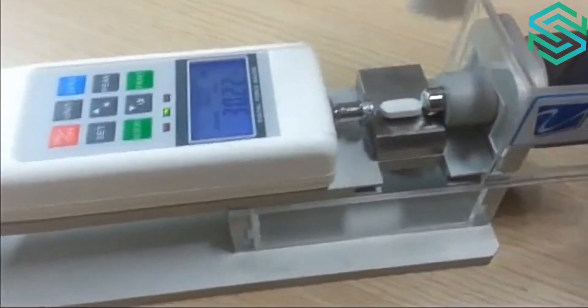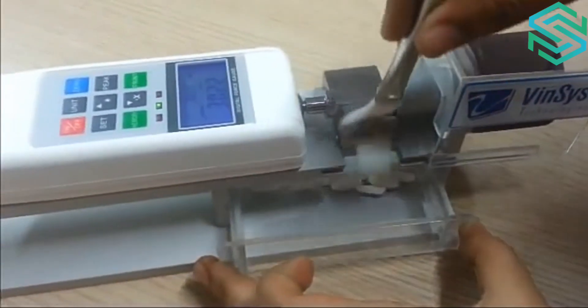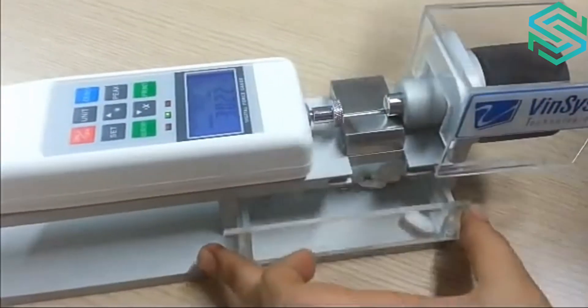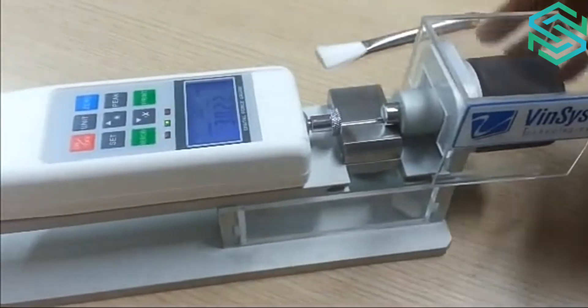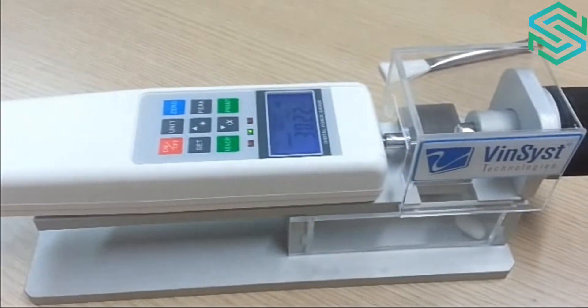You may clear the debris in the box given below and the instrument is ready for another test. Thank you.